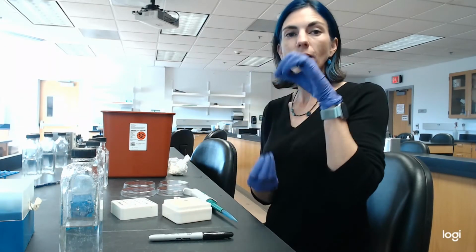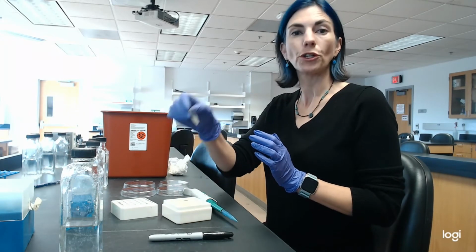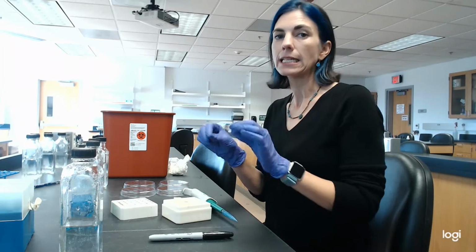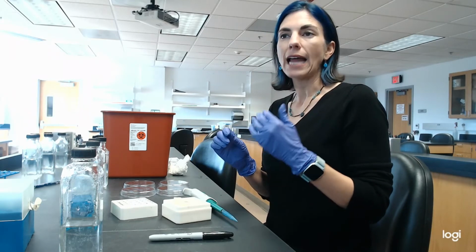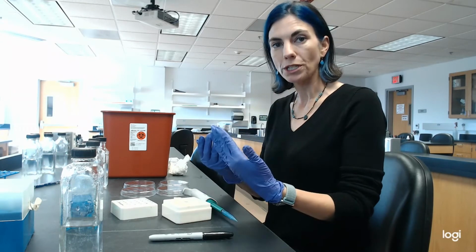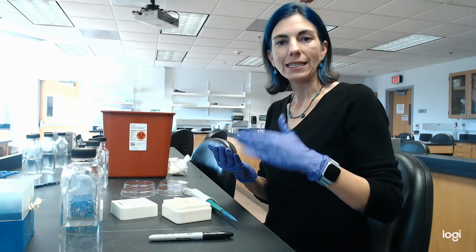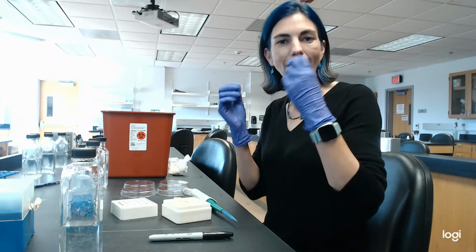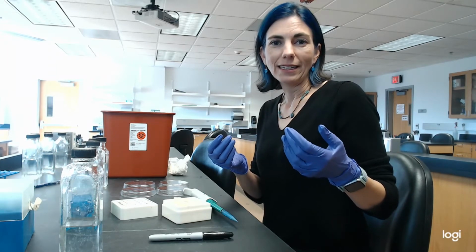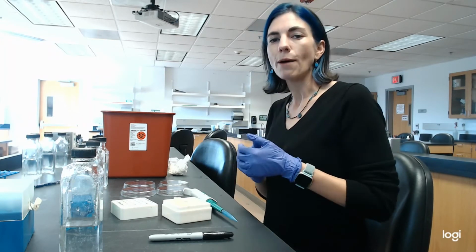But I collected all my saliva into one tube and then split that tube up into 4 of these small tubes. And the reason why I collect all the saliva at once instead of spitting into each tube is because as you collect saliva and spit, and then you try to get more saliva to get more spit, it's possible that you actually decrease the number of microbes in subsequent spits, simply because you've gotten most of the microbes out in the first batch, loogie, expectorant, I don't know, whatever you want to call it, the first batch of saliva versus subsequent batches.